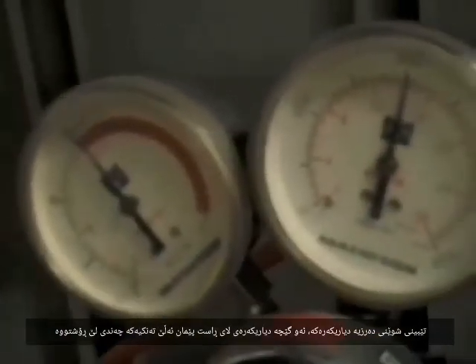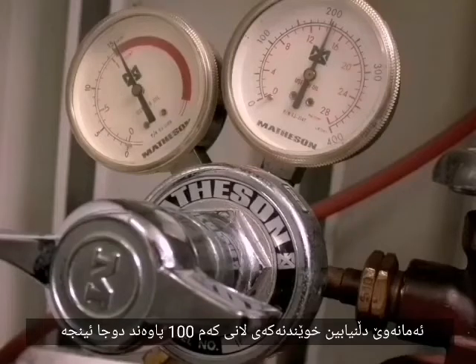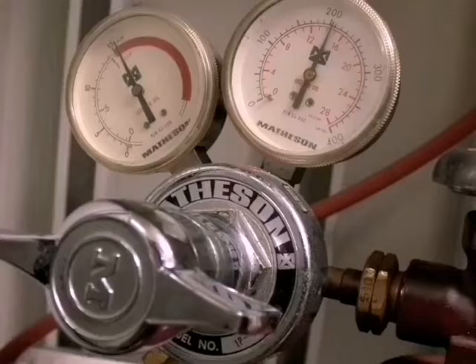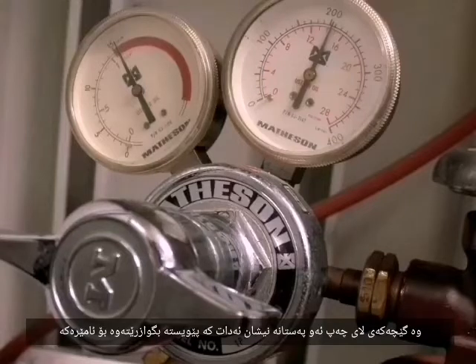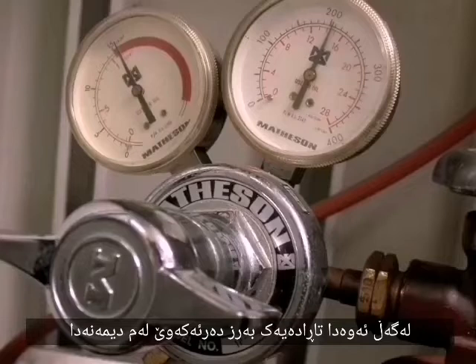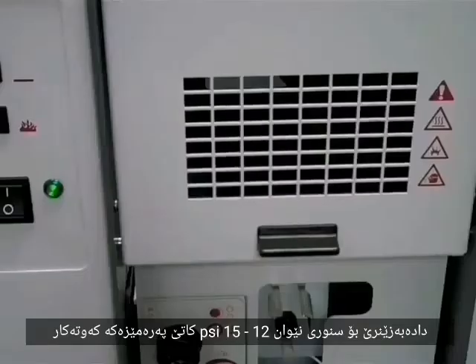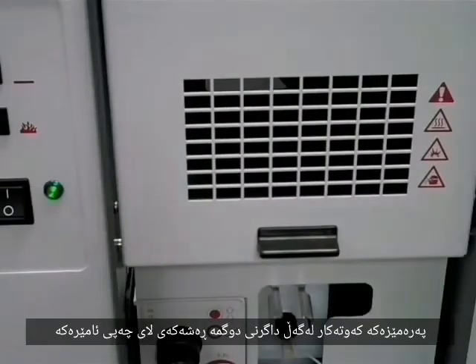Note the position of the indicator needles. The indicator on the right tells us how much is left in the tank. We want to be sure that it reads at least 100 pounds per square inch. The indicator on the left shows the pressure that is being delivered to the instrument. Although it is a bit high in this picture, it will drop down into the range of 12 to 15 psi when the burner on the instrument is turned on. Turn on the burner with the black button on the left-hand side of the instrument.